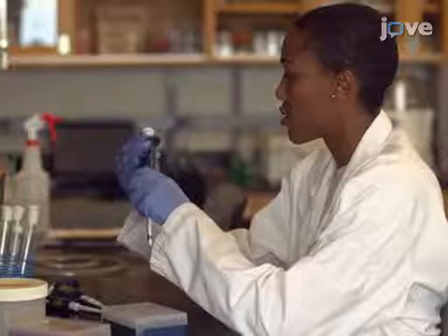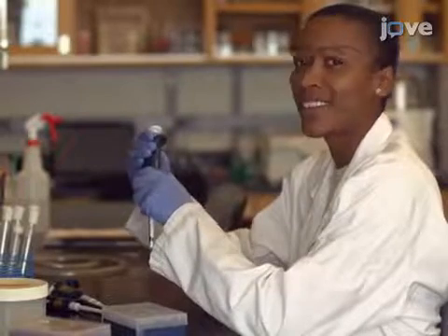The main advantage of this technique is that it's inexpensive and easy to perform and interpret. Demonstrating the procedure will be Aretha, a student in the laboratory.